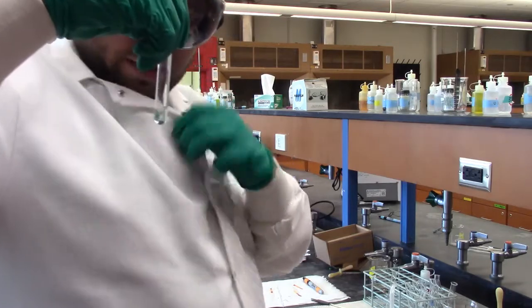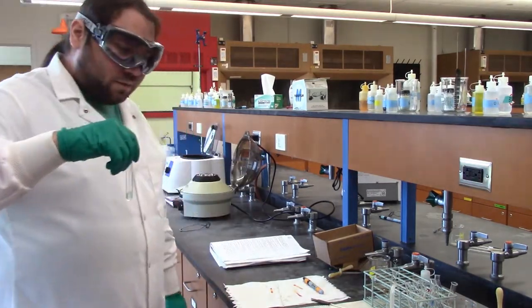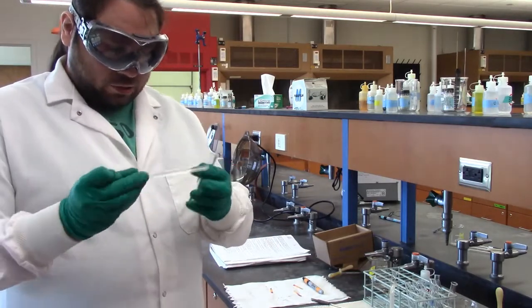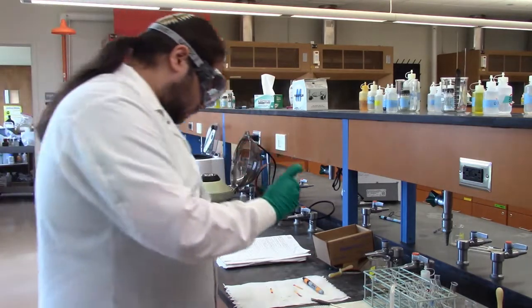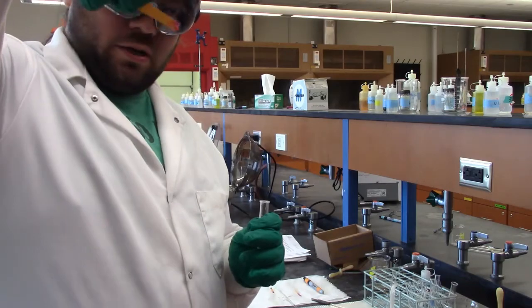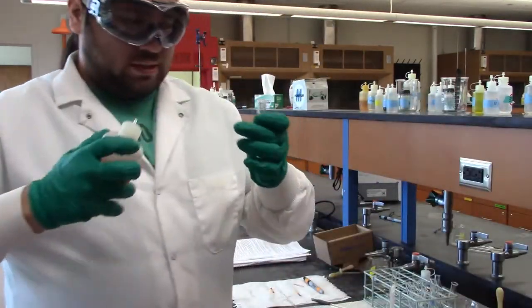If you look at it closely, hold it up to my white lab coat, this is already a pale blue color. So it's probably some copper in there, but we can make it even bluer. So we're going to add some 6 molar NH3 to make it basic. As usual, let's check our starting pH. Very definitely acid. I forgot to get a clean piece of pH paper, so I'm using a different one, but there's our acid. It's clearly acidic. So let's add some NH3, which is one of these bottles. It's this one. So let's see if anything happens when we do this.